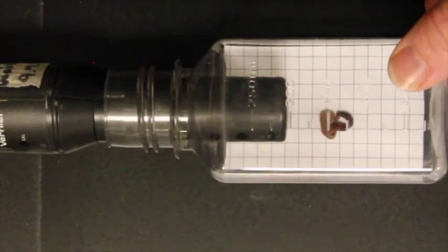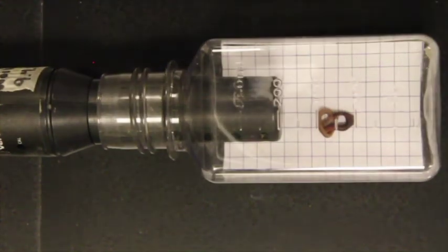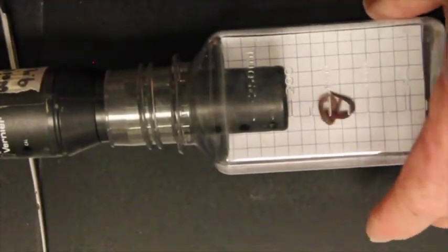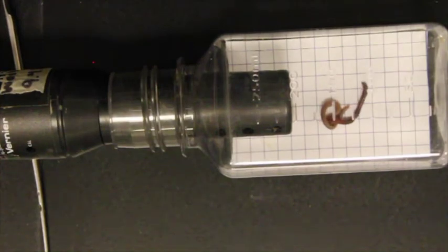And get it all set up where you can see it. We need a little bit of something to make that flat on the top. Okay. And there we go. So we're all set up and ready to go. All right, give this 3 minutes to equilibrate, and then we will run the experiment.